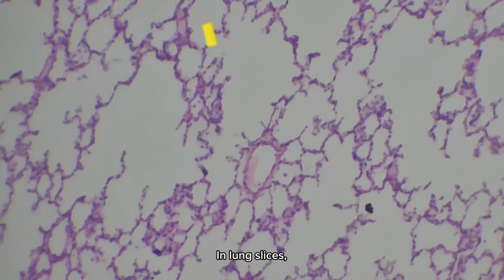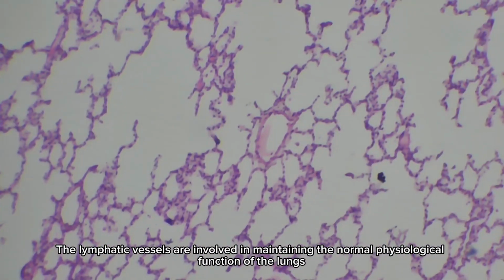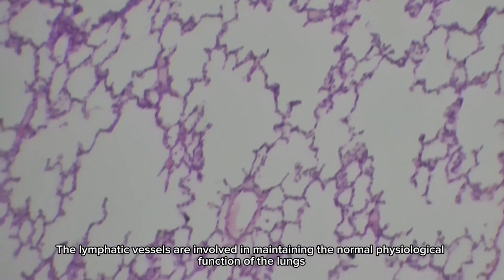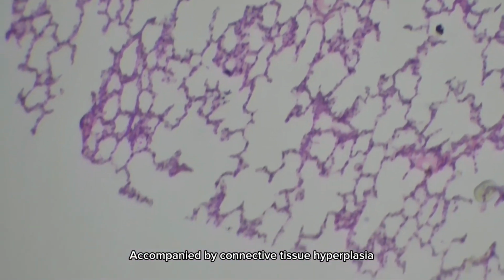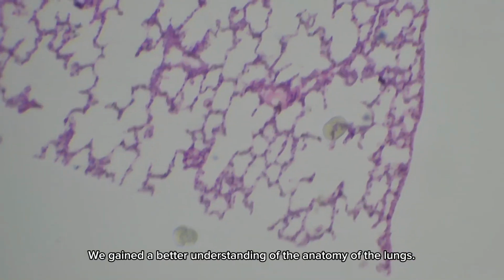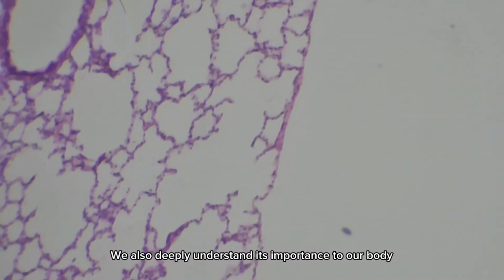In lung slices, we can also see some other structures, such as lymphatic vessels and some body tissues. The lymphatic vessels are involved in maintaining the normal physiological function of the lungs. When there is a problem with the lungs, large numbers of lymphocytes appear in the alveoli, accompanied by connective tissue hyperplasia. By observing lung slices, we're learning a lot more about the anatomy of the lungs. We also deeply understand its importance to our body.